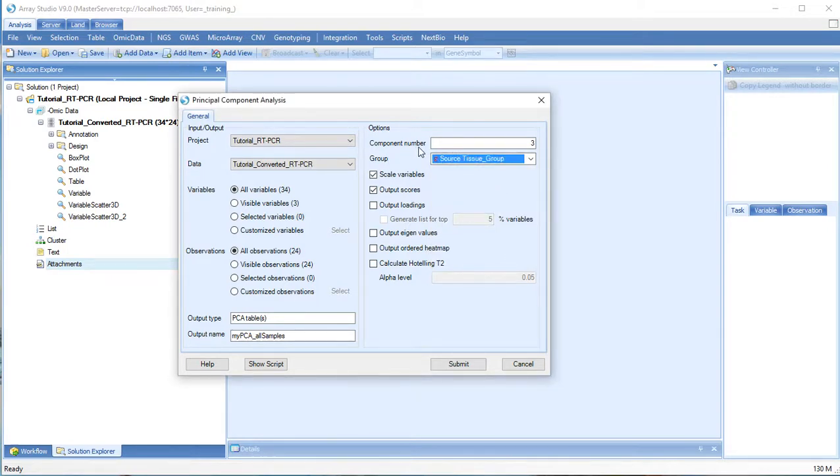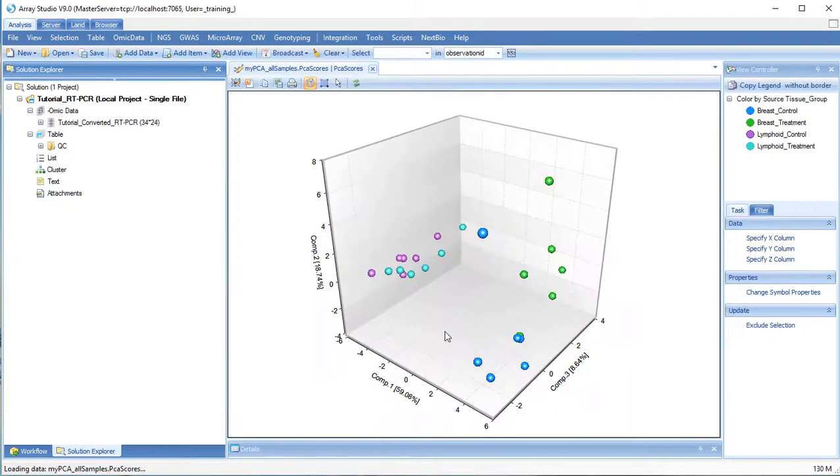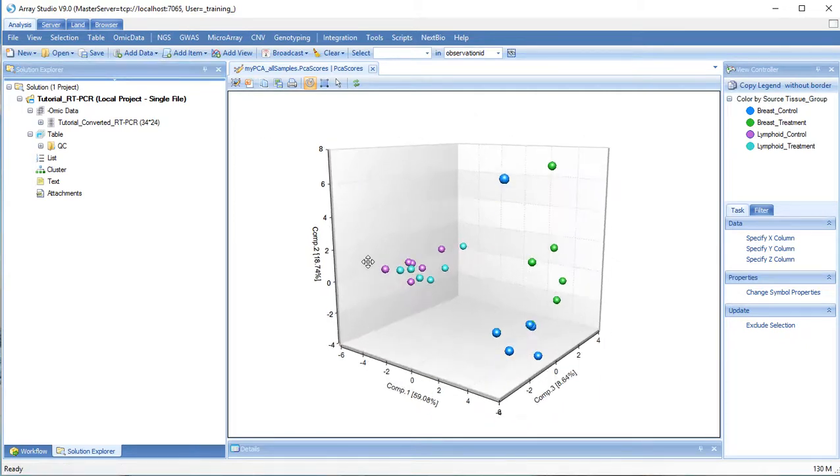If you perform a 2 component analysis and check this box, the plot will show ellipses indicating the confidence interval for each group specified here. With a 3 component analysis, a 3D plot will be shown.